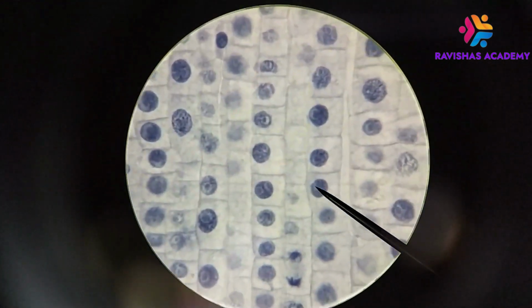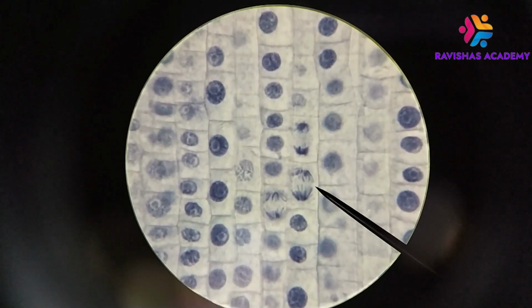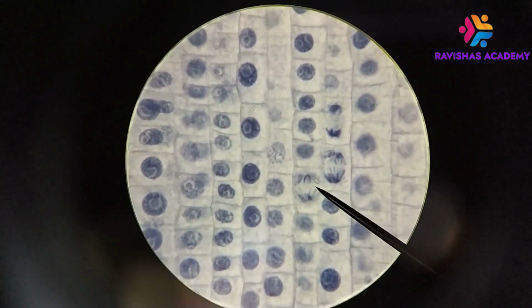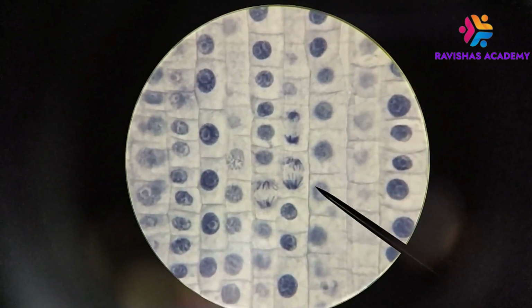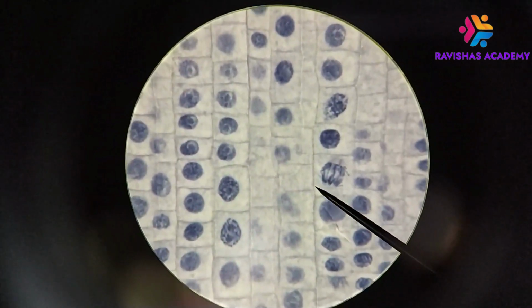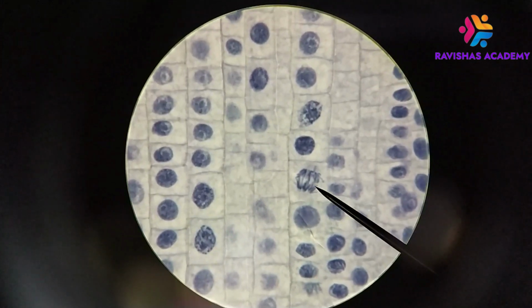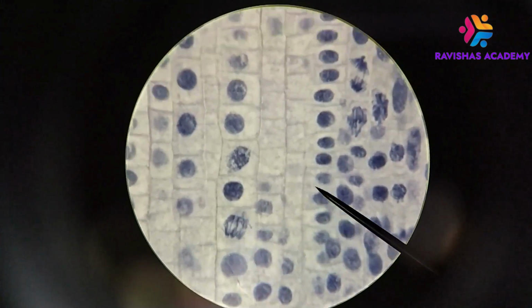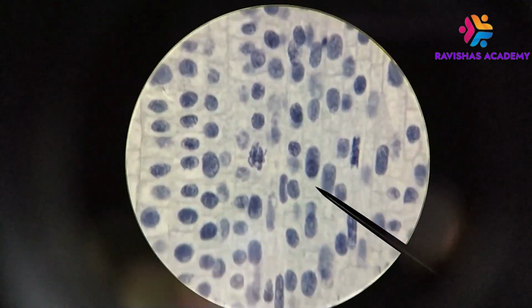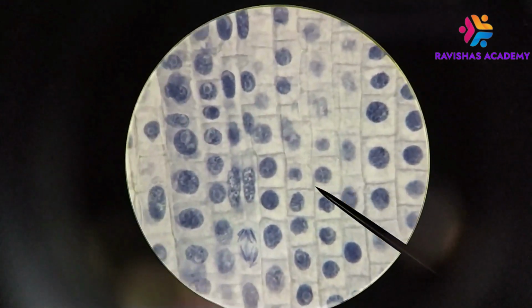So, as you can see, there's a wide variety of things that we're seeing here. Oh, more anaphase, two cells doing this one here, one right next to it. The fact that they're close together is more of a coincidence than anything else. So one of the things I want to point out here is that, again, you're seeing different stages. Each cell is doing its own thing. So when you are looking at a slide and you're trying to figure out, is this mitosis or meiosis, one of the things that you want to look at is, am I seeing the cells doing the same thing, or are different cells doing different things?